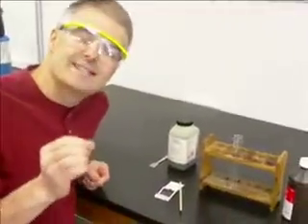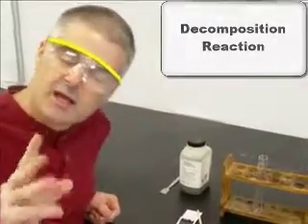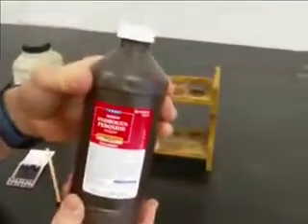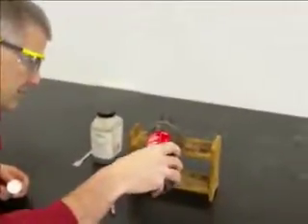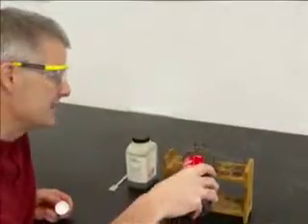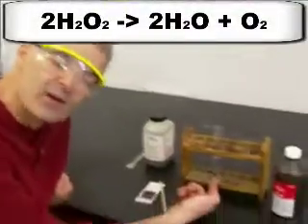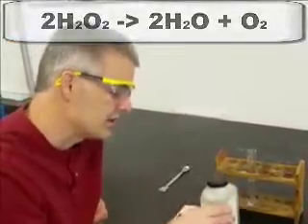I want to show you today a decomposition reaction. Remember, in a decomposition reaction, you start with one thing and it breaks apart into multiple things. The chemical I brought with me today is hydrogen peroxide. This is the stuff that you can just buy at City Market or King Soopers or whatever your local grocery store is. I'm going to pour that into a test tube. Hydrogen peroxide by itself decomposes into water and oxygen gas. It's actually decomposing right now, but it's a very, very slow reaction. So I'm going to add something to it that should speed up the reaction.